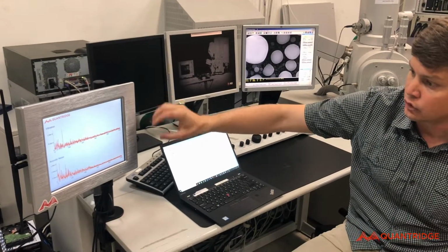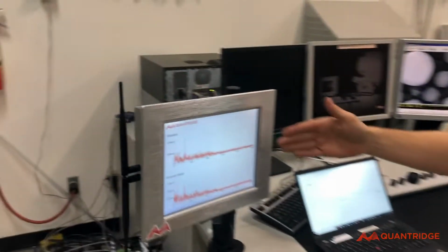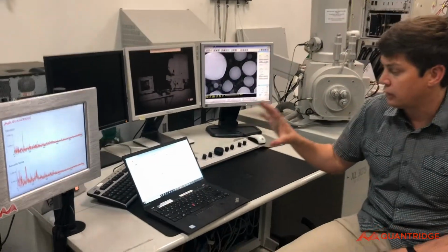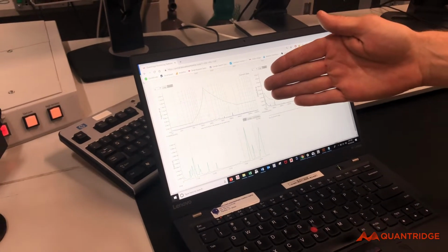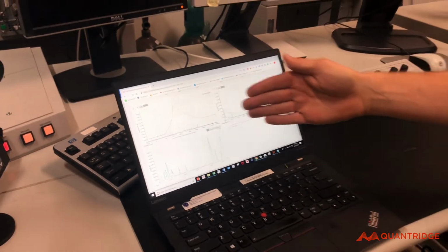It is a 2-channel version. It's streaming both live vibration data and acoustic noise. We have a microphone right there and an accelerometer here on the floor. I have the IoT version streaming from the cloud. We have the current FFT on a 10-second delay right here, and then historic vibration level at the compressor frequency.